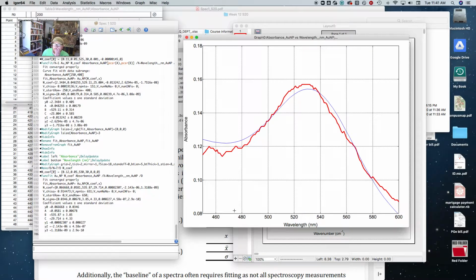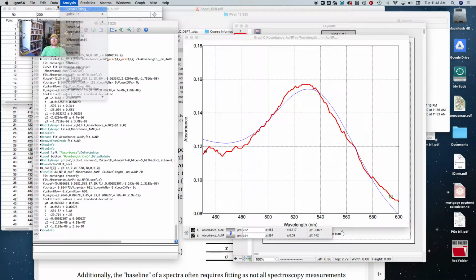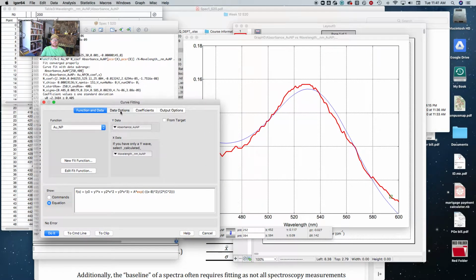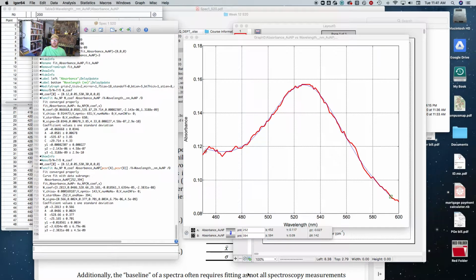The first couple times I was playing with this, it didn't really want to find a great fit right away. So another thing I recommend doing, go to graph and show info. And I'm going to use these cursors. I'm going to drag the A cursor and put it right there. And I'm going to drag the B cursor and put it right there. And now I'm going to go back to this curve fitting. And up here, I'm going to say on data options, cursors. And let's say do it. And hey, look at that. That helped quite a bit. Okay, so that's actually a really nice fit.